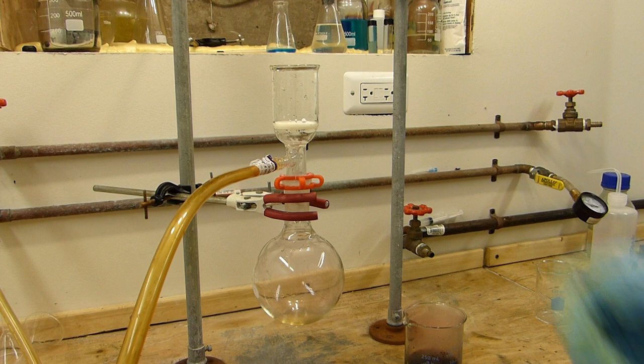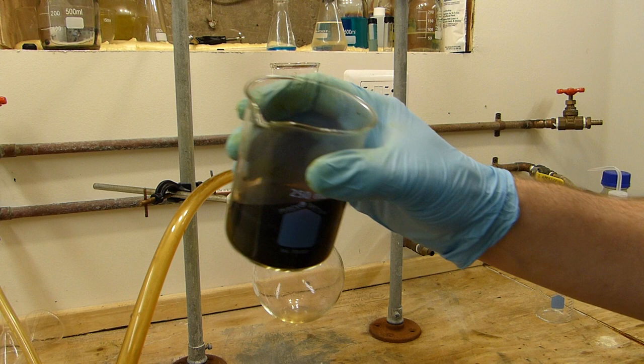You can see the water was pulled out of frit. I always just wash so it had a little bit of water in it. And we'll also need a stirring rod because the iodine is quite dense and it will have mostly sunk to the bottom of the beaker as you can see maybe there for some chunks.